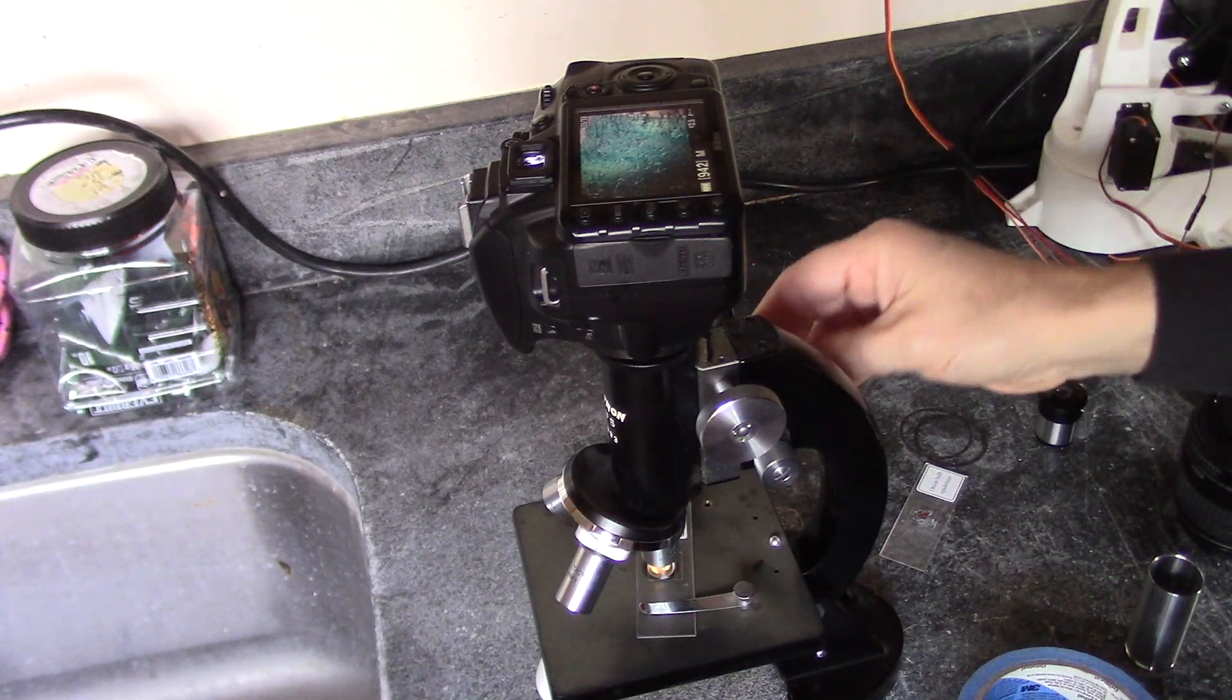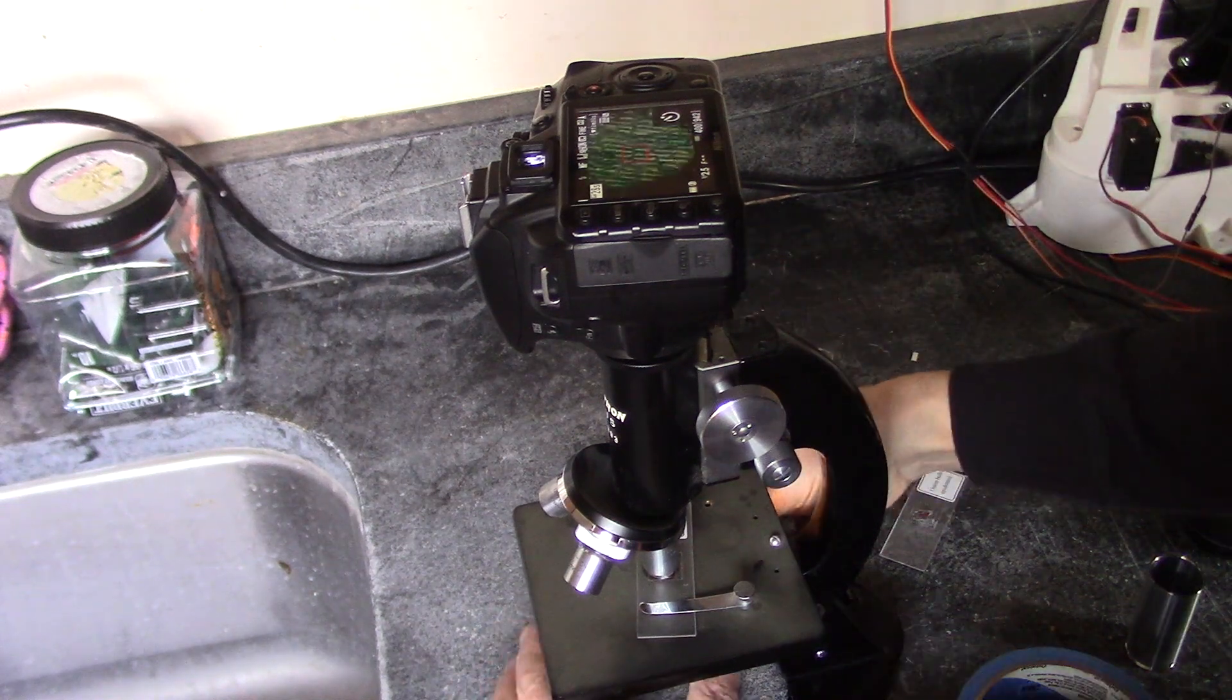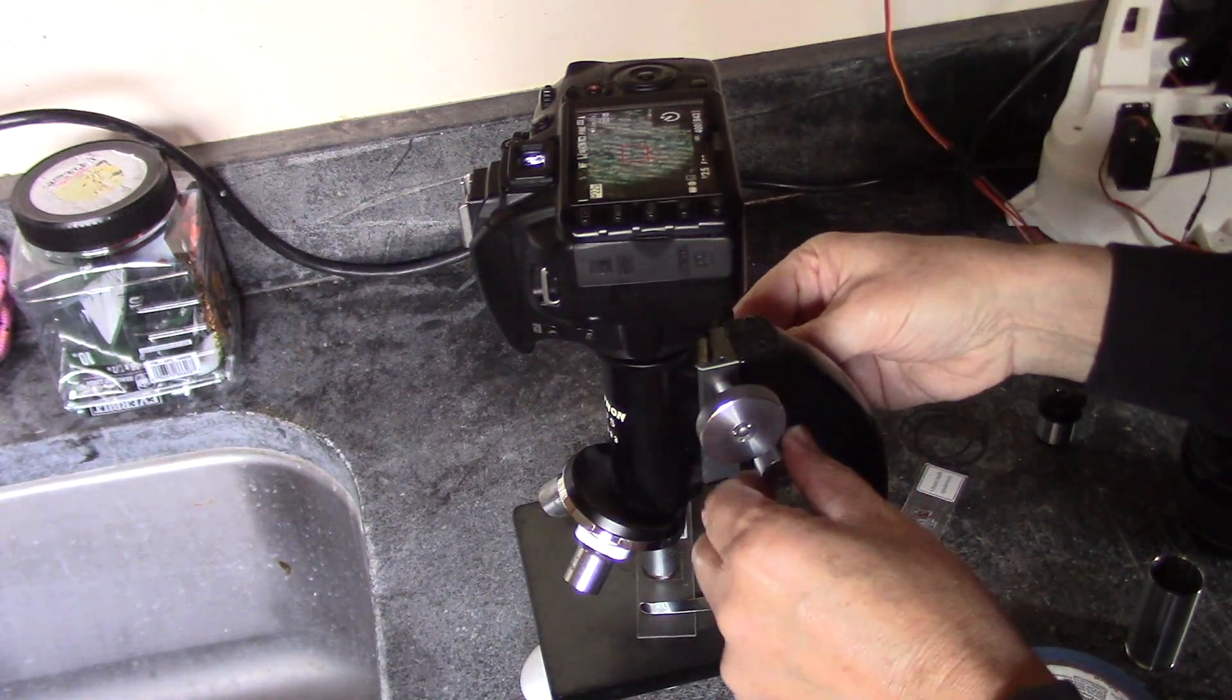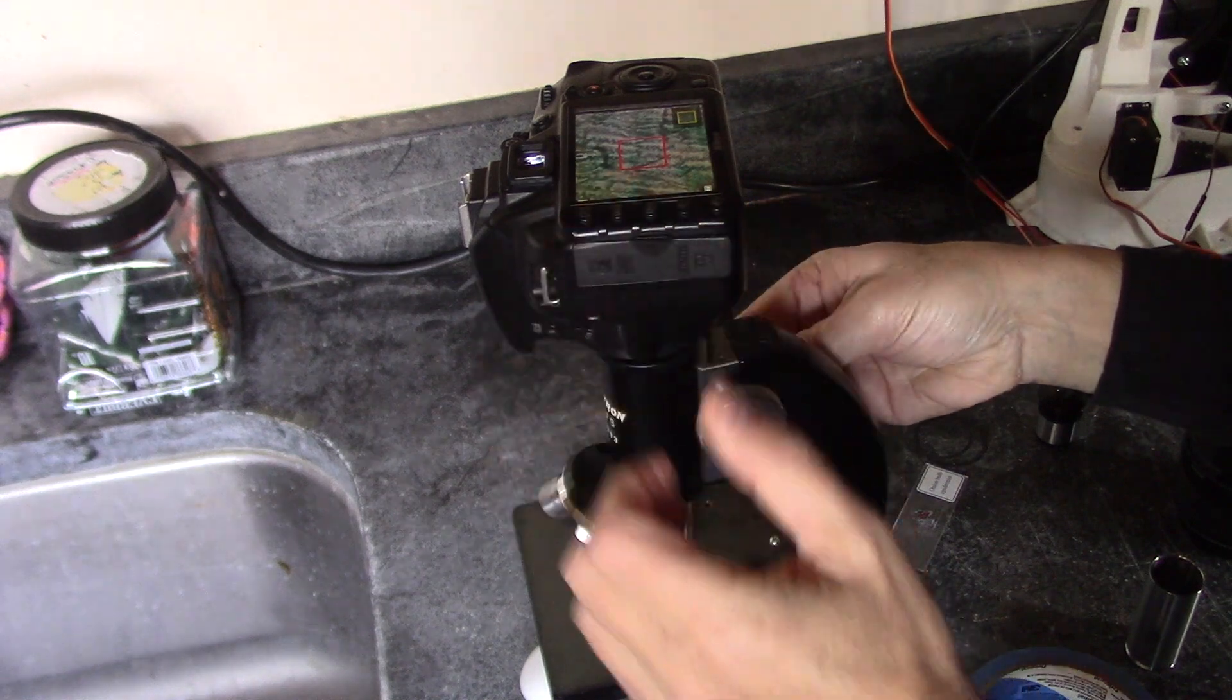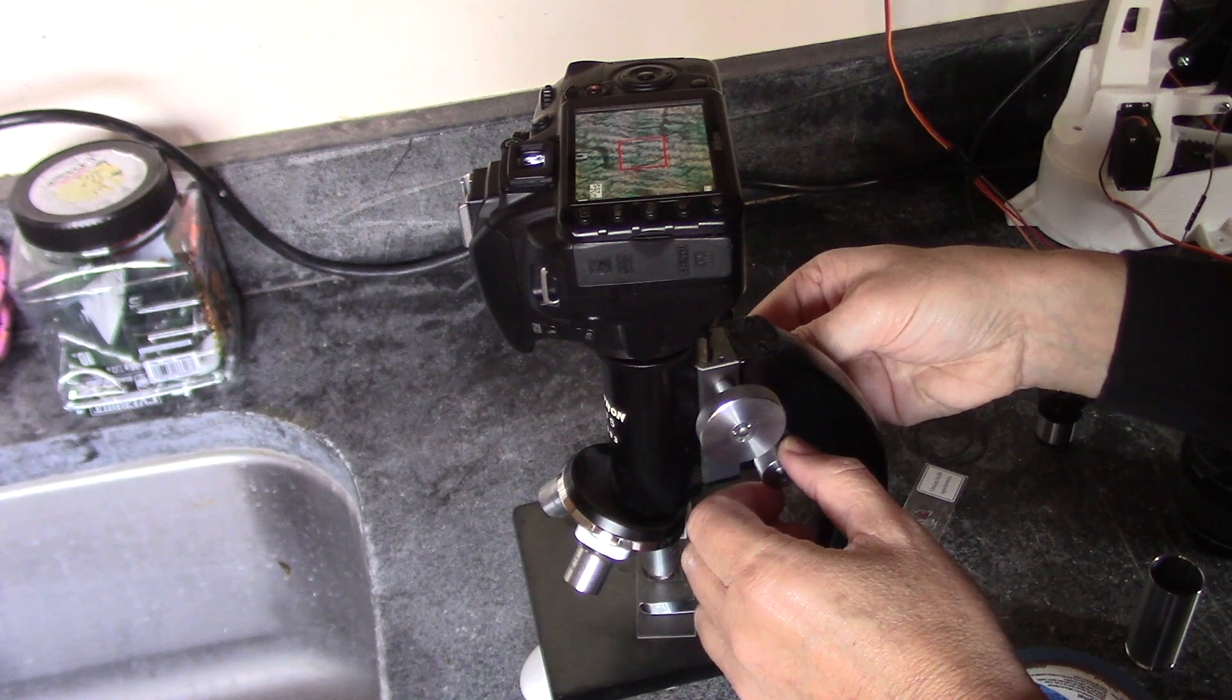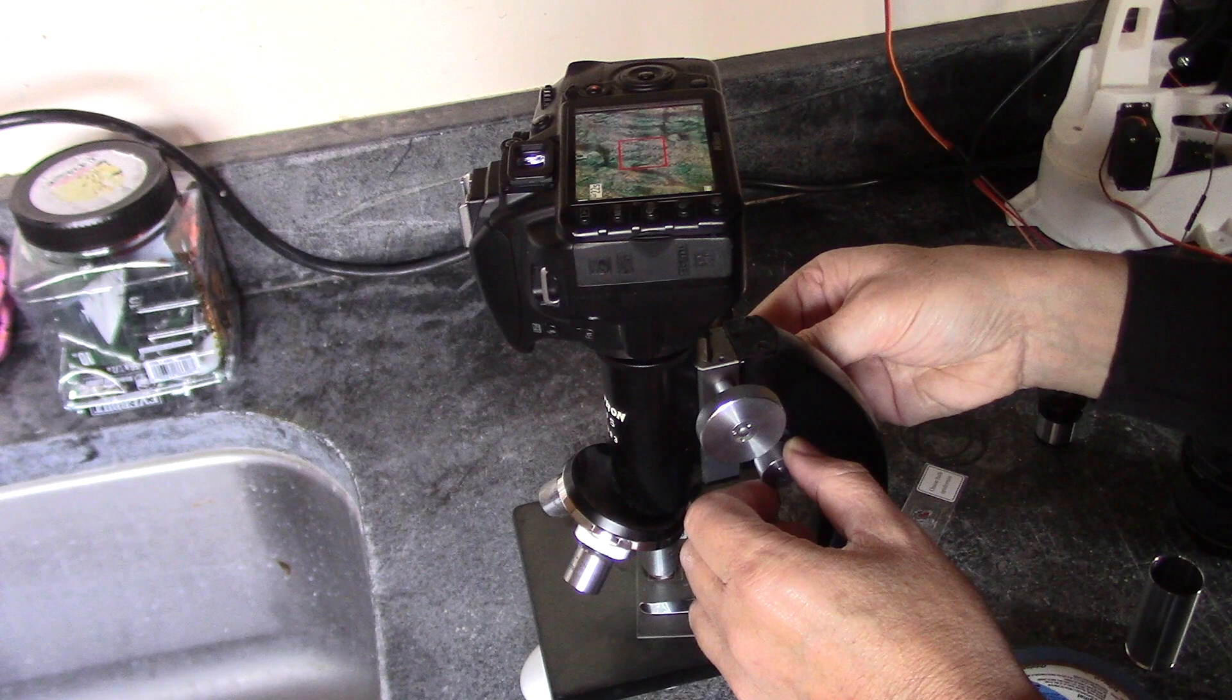All right, now I want to try even higher magnification and see how clear we can get this. Now it's quite dark, so if you can see I'm adjusting that light, and then the focus not quite right. Let me zoom in a little bit and see if I can get that right on the... As you go higher magnification, then everything gets a little bit more challenging to get it in focus.